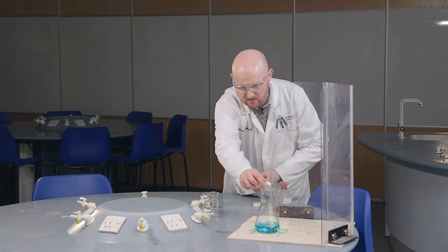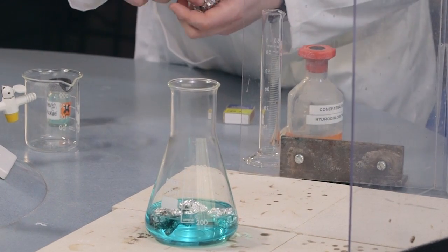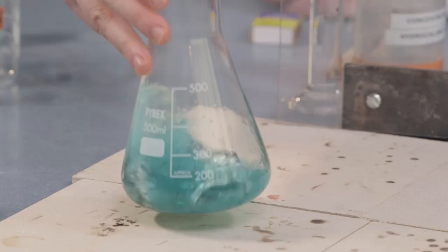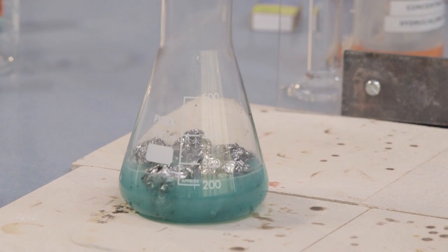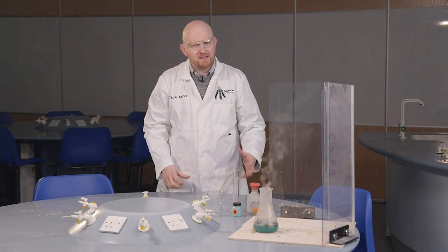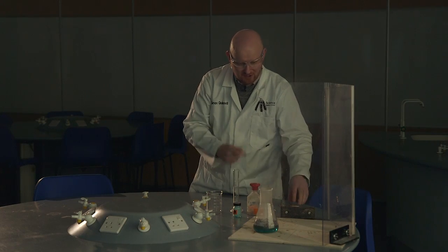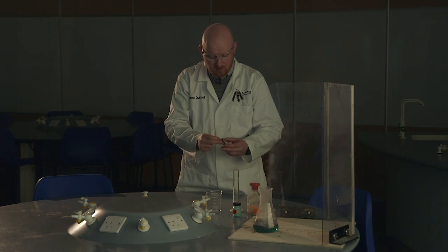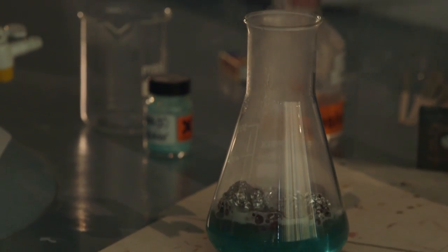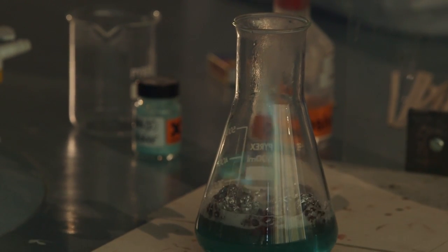I'm going to add the aluminium foil into our solution — you should start to see it react quite quickly. Give it a stir. You can probably already see it going quite dark, and you can start to see the hydrogen coming off as well. The best way to see this is if we turn the lights off. Now we ignite the hydrogen that's coming off, and we should see our Northern Lights, which will light Santa's way to our house to deliver our presents. I'm just going to ignite. And there are our Northern Lights flickering away.